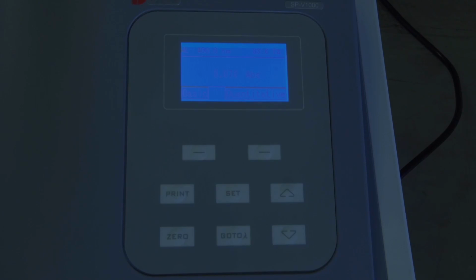You should see an increase in the absorbance values from solution 1 to 6. Thereafter, you should have a fairly constant value between the 3 cola samples. From here, you have got your data to plot your curve and determine the amount of phosphate in cola.